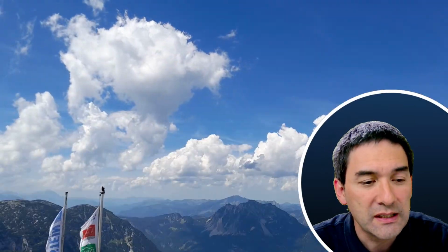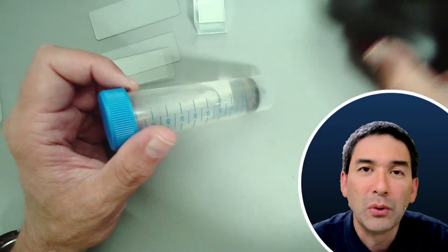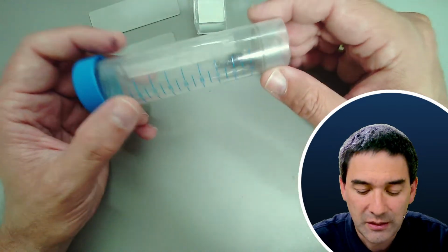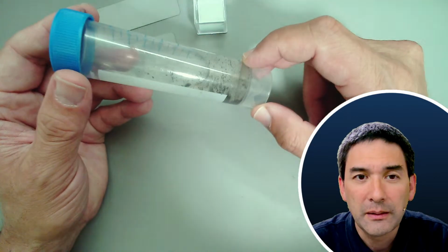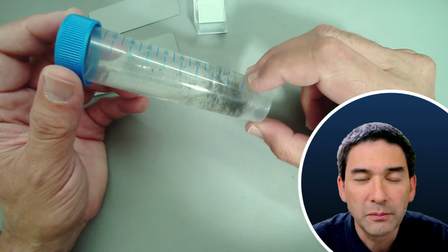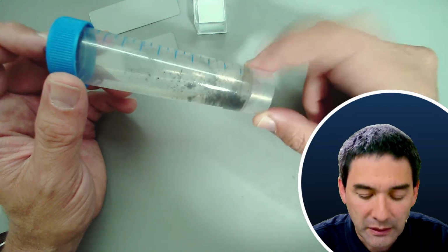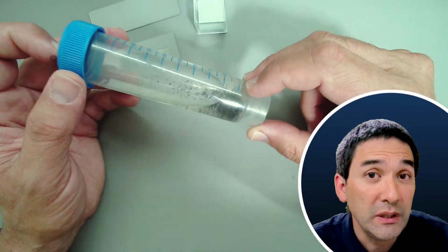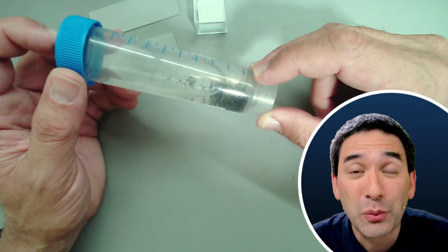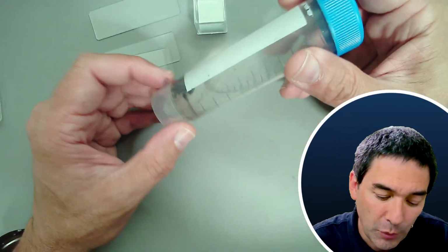I also have to give you a slight disclaimer here. Let me see where I can find the desk view. The disclaimer is it's not going to be the most exciting sample. You can see that obviously the snow already melted, but the black material is in here. I did already observe it. A couple of things are recognizable, pollen, for example, and some plant material. We're going to look at it again. However, there will not be any microorganisms, or at least no interesting microorganisms visible. Bacteria are of course always present, but they can be difficult to see here. So it's not going to be the most exciting sample.